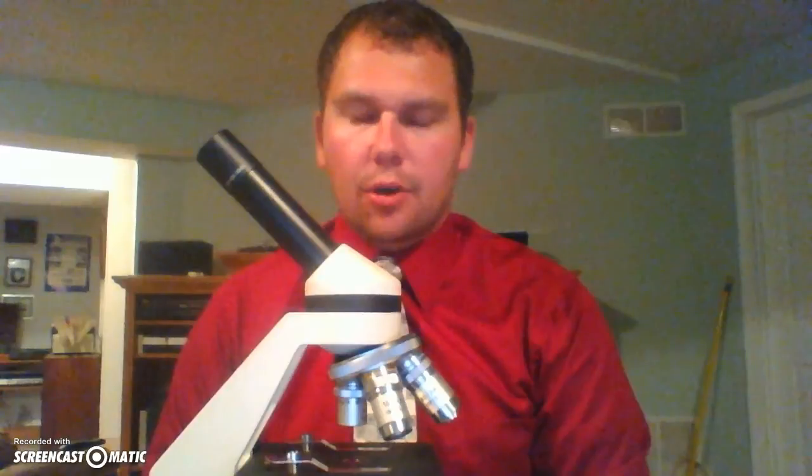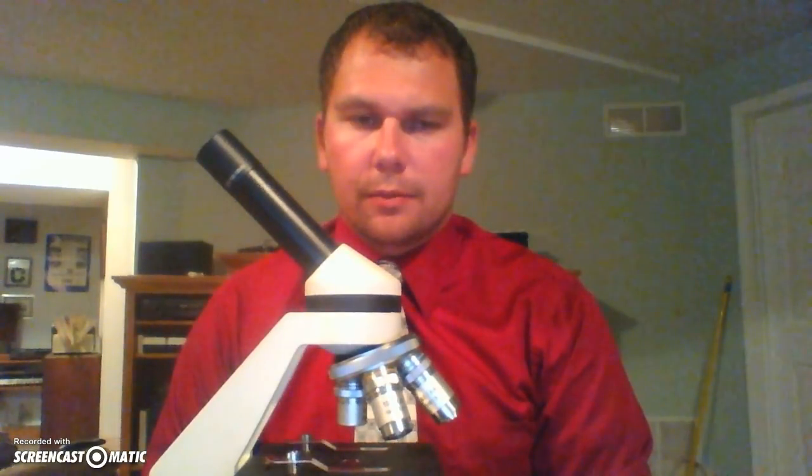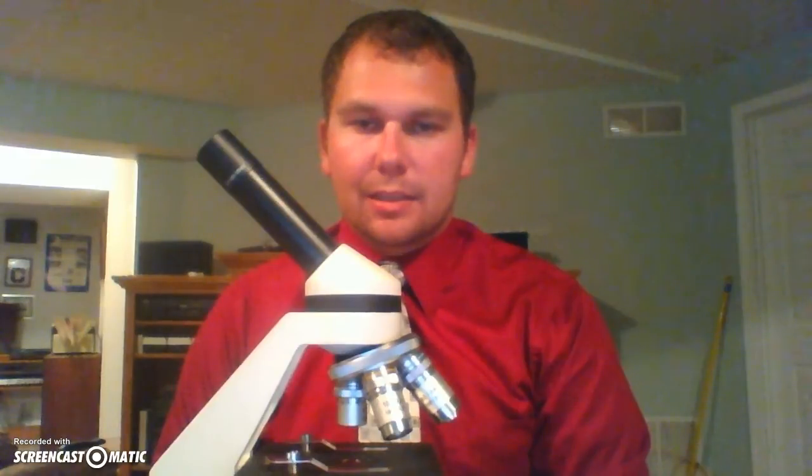The first thing I want to familiarize you with is the microscope itself. Now, you as a student have already filled out a card which has all the parts of the microscope. If you would like to make reference to that, please do so now. Make sure you have it. Through these many films, you will be answering questions. Please have a separate sheet of notebook paper to write your answers down. I do ask that all of your answers be in a complete sentence. You do not have to write the question; however, I do ask that you write your answer in a complete sentence. Without further ado, here is the introduction.